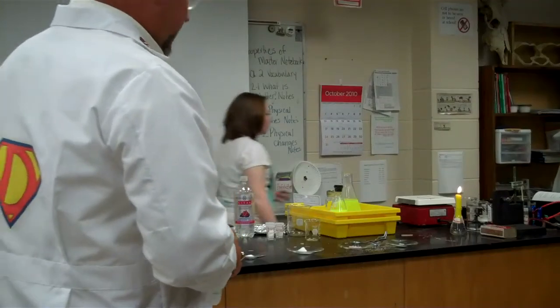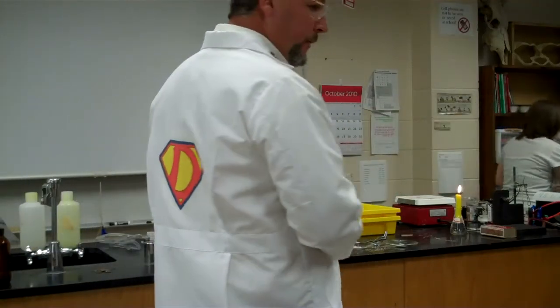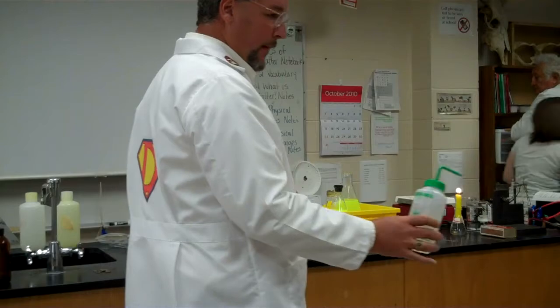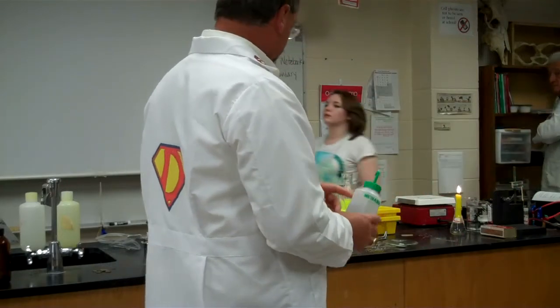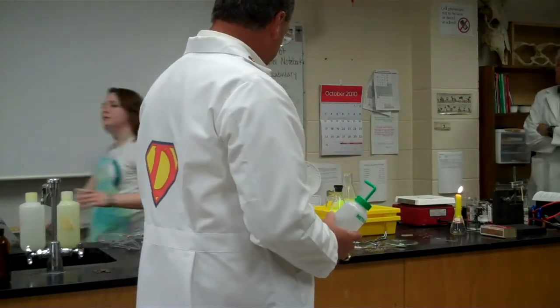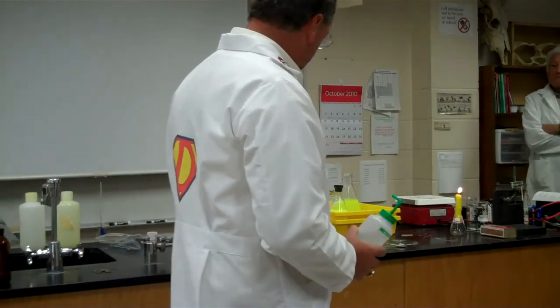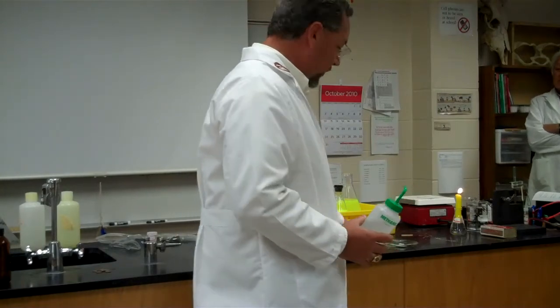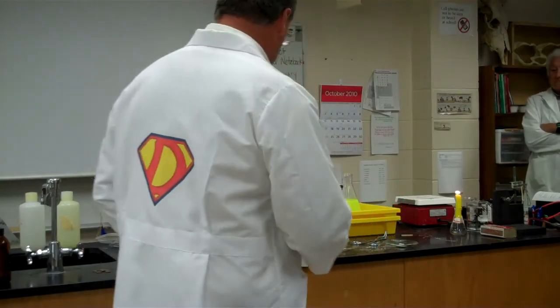Metals burn with different colors. So what we have here are four different metals, and this is just methanol. When we combust the methanol — burn the methanol — what it's going to do is provide heat to the metal, and the metal should release its color. So we should get different colors.